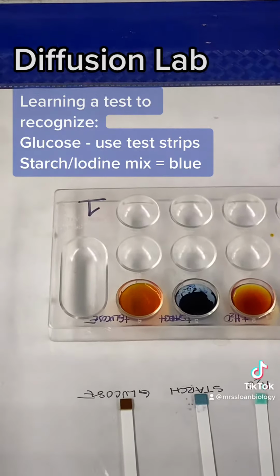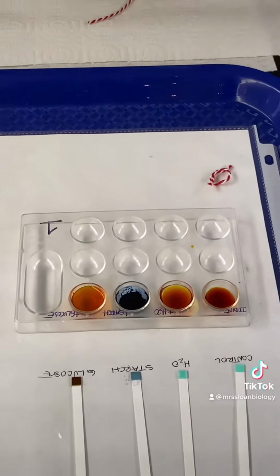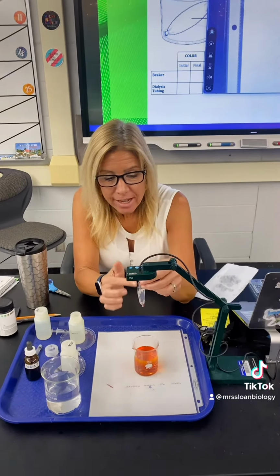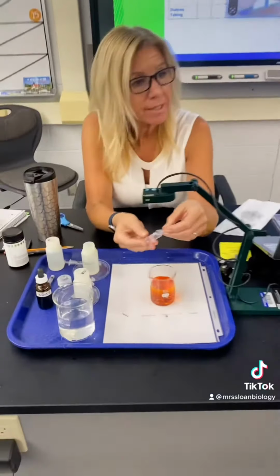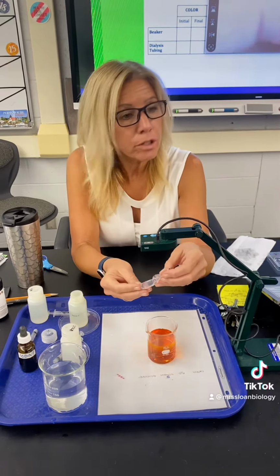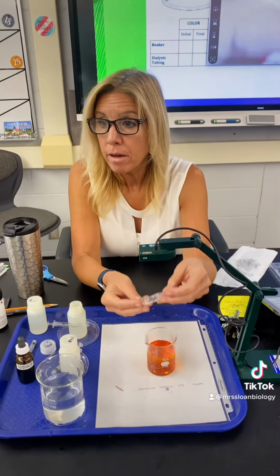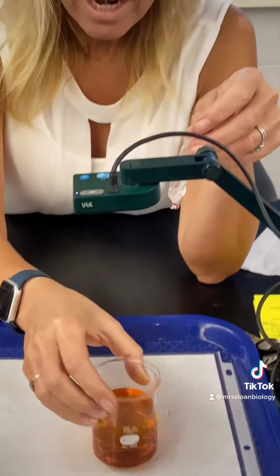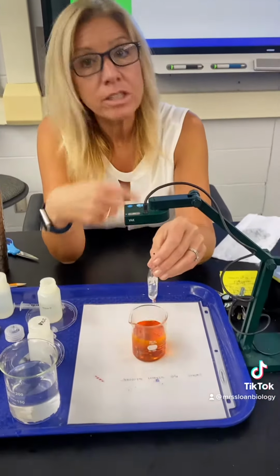Okay, so iodine is used to test for what of those different solutions? What are we using iodine to test for? Starch. Good. So this dialysis tubing is modeling for us a cell membrane. And what did we put inside this dialysis tubing? Starch and glucose. And glucose would be characterized as a what? Monosaccharide, and the starch would be a, so two different sizes, yes? So maybe some things are going to move or some things are not. And this right here is water, and what else is in here? Iodine. Great, so we're just going to plop this in here and see what changes happen.